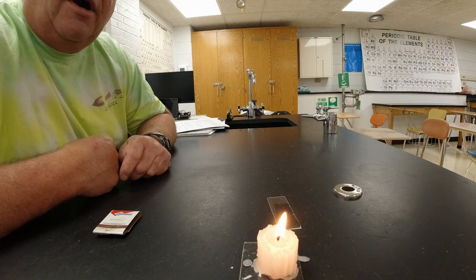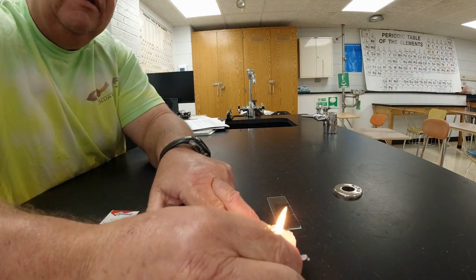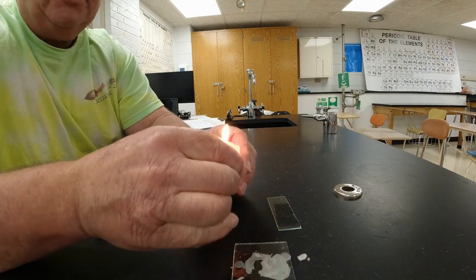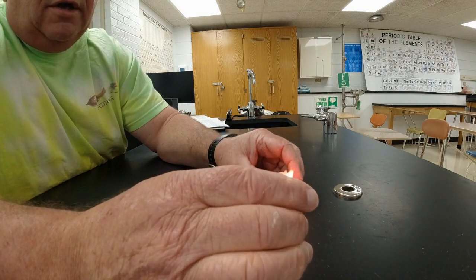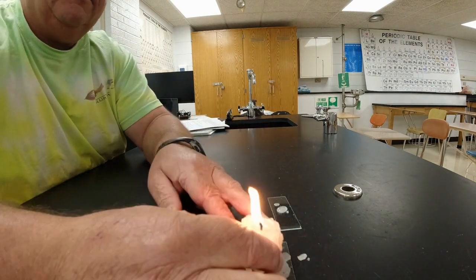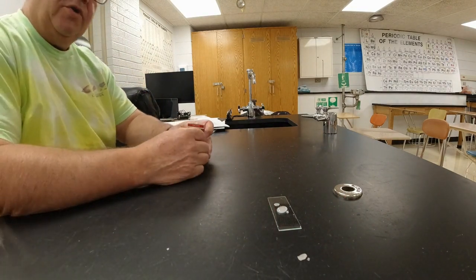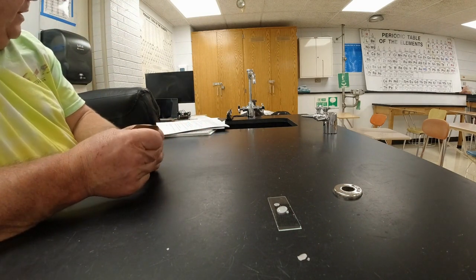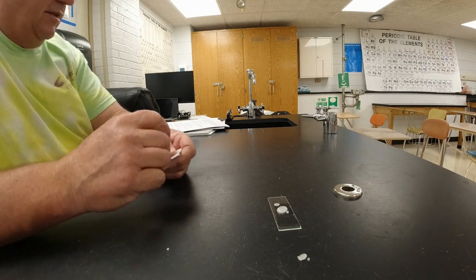All right, in part number 4, what we're going to do is take some candle wax and put it onto a microscope slide. Now, it says to use a micro spatula to scoop it out of there. What I'm going to do is just pour a little bit here onto the side. So there's some wax over there. It says in number 4, use the micro spatula to transfer a small amount of liquid from the bowl of the candle to a microscope slide, and then try to light the wax and note the result.